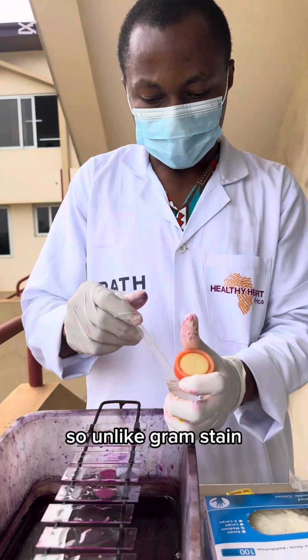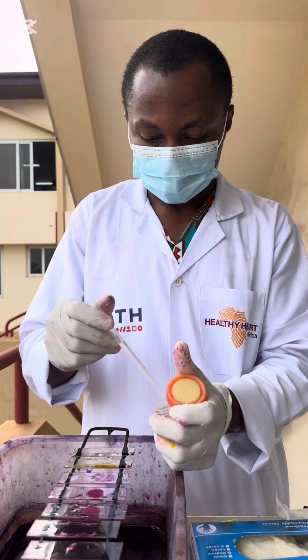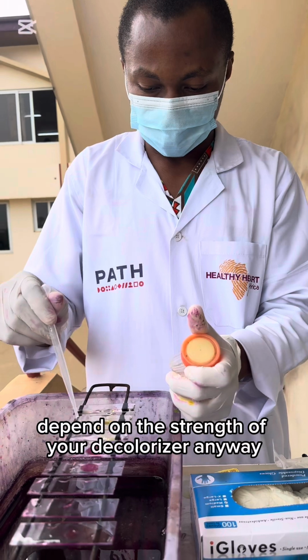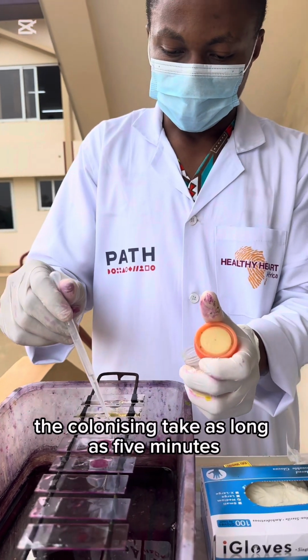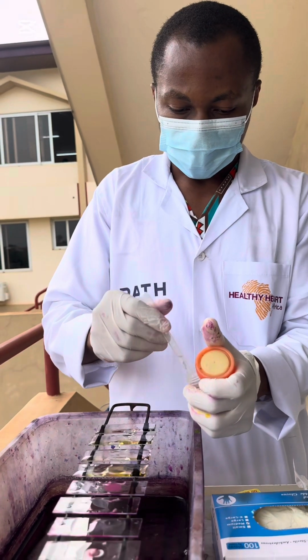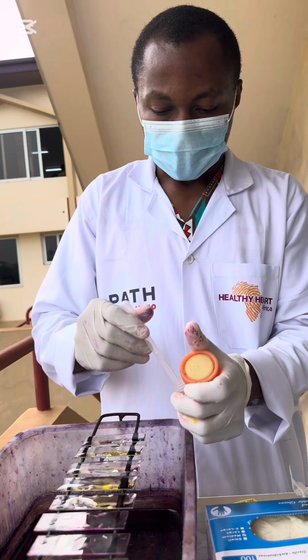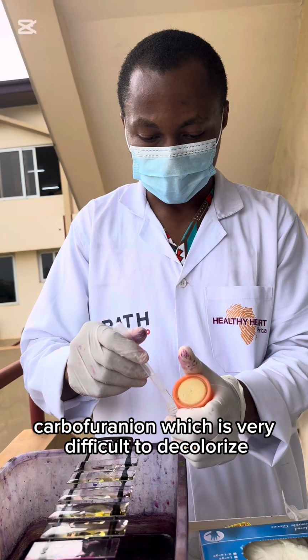So unlike Gram stain, where decolorizing may take 5 seconds, depending on the strength of your decolorizer anyway, in Ziehl-Neelsen staining, decolorizing takes as long as 5 minutes. This is basically because we are using a very strong dye, carbol fuchsin, which is very difficult to decolorize.